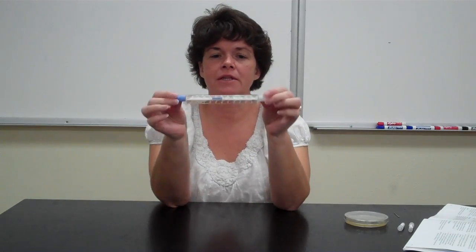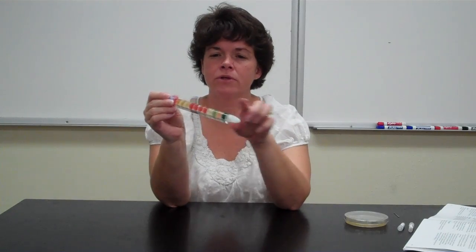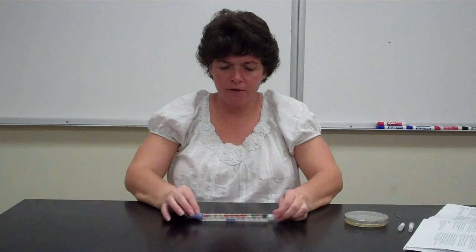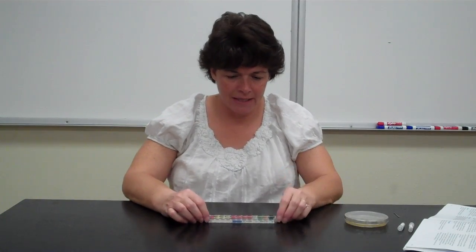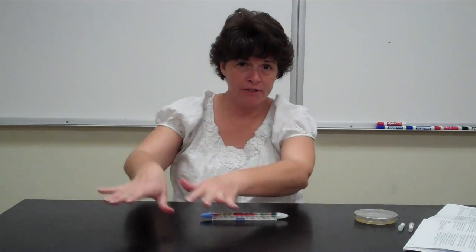So then you're gonna take this whole thing and you're gonna label it with your name and your group over here, and you're gonna put it in the incubator flat side down, okay? So when you come back the next time, you're gonna read your results. Now at this point you will have a flame. It's imaginary, see it's right here, and I'm wearing my goggles and my gloves.